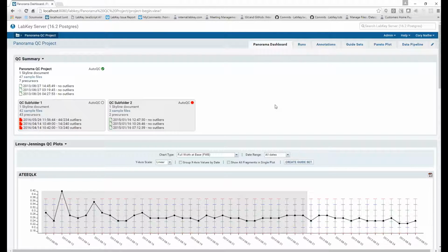The first improvement made to this summary display is to include information about subfolders for the given container. So you'll see here I have a Panorama QC project set up, and in this case I have 3 direct subfolders, some of which might be of type QC and some which are not. Previous to the 16.2 release, this QC summary web part only showed information about the current container.